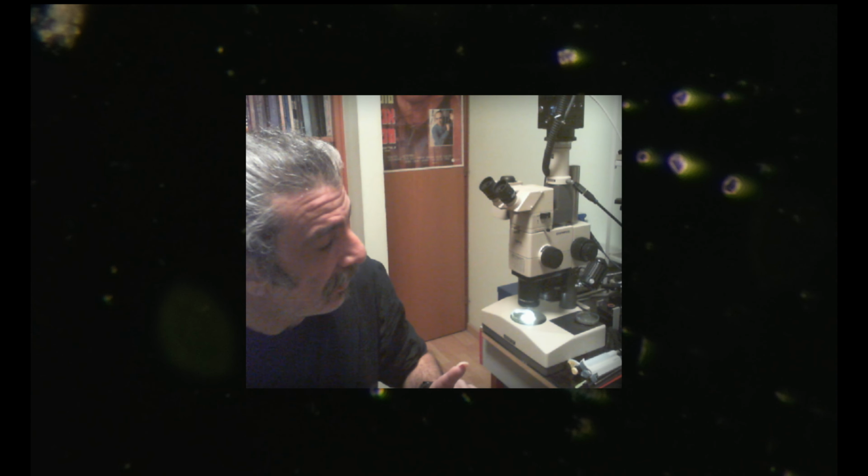Sorry, we have a little bit of difficulty. I'll try to solve it for a sec.